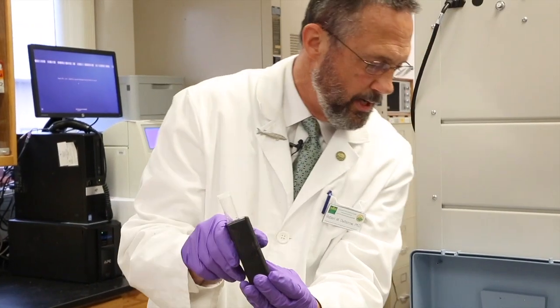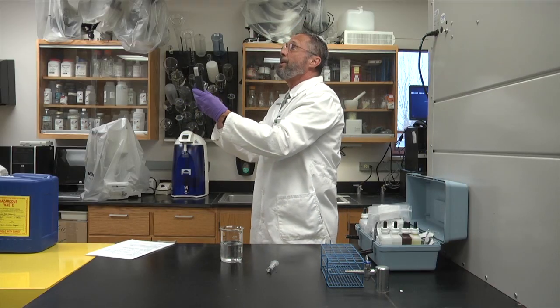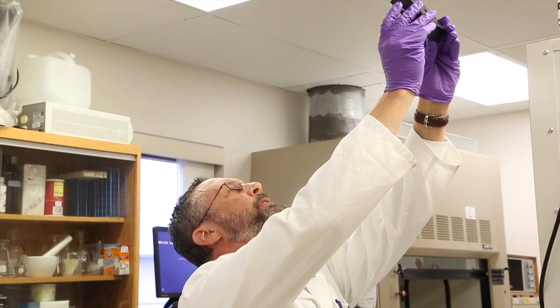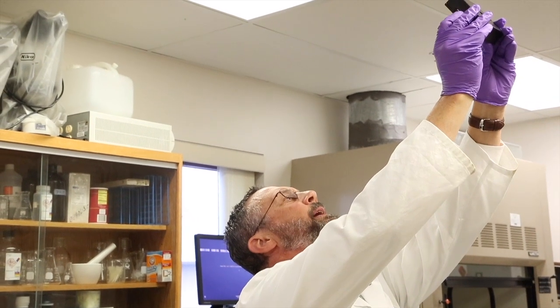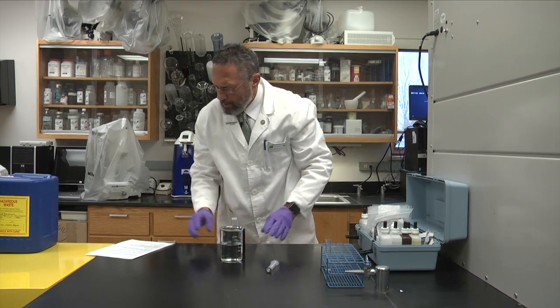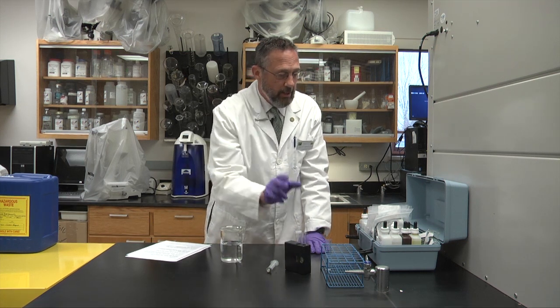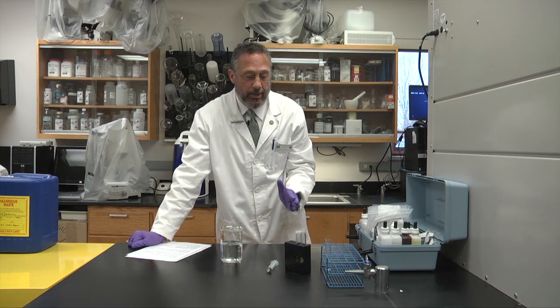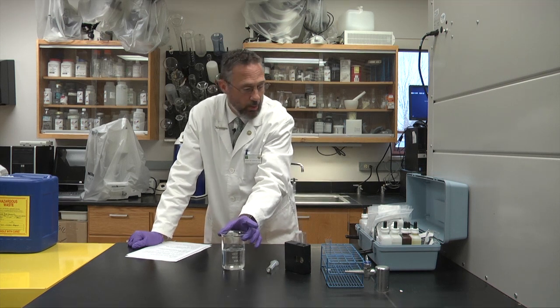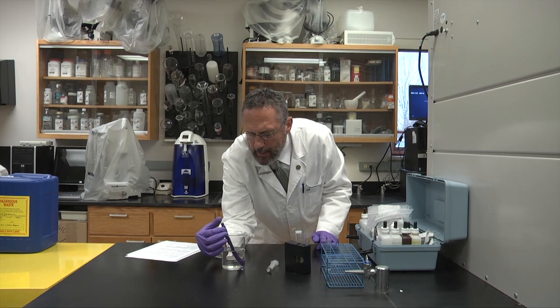We'll put it in this box on the right side, and we'll take the blank tube that we didn't add anything to on the left side. Then what I do is I usually hold it up so that I have fluorescent lighting in back of me and in front of me, and I try to match the color wheel reading with the test tube, and I get a 1.2. So I get a 1.2 parts per million or milligrams per liter of total ammonia with this test here. Now there is also the most crucial step here is to calculate the toxic ammonia. And in order to do that, we need to check the pH and temperature of this water. And then we will refer to a table, and we'll get a number from the table based on the temperature and pH readings.